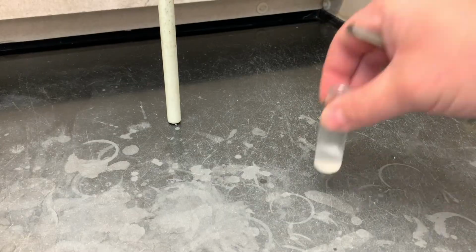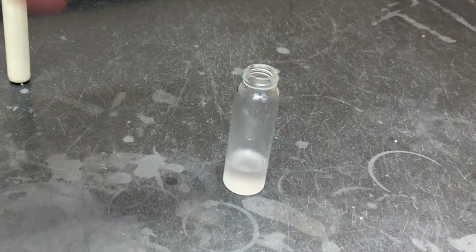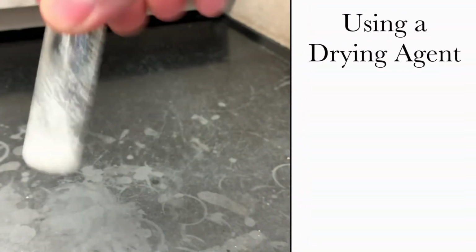Now we're going to want to neutralize that acid and remove the water. To do that, we're going to use some sodium carbonate. Now the exact amount you need is going to be different from time to time, from student to student. What you're going to do is add some, shake it up, and look for these 3 criteria.